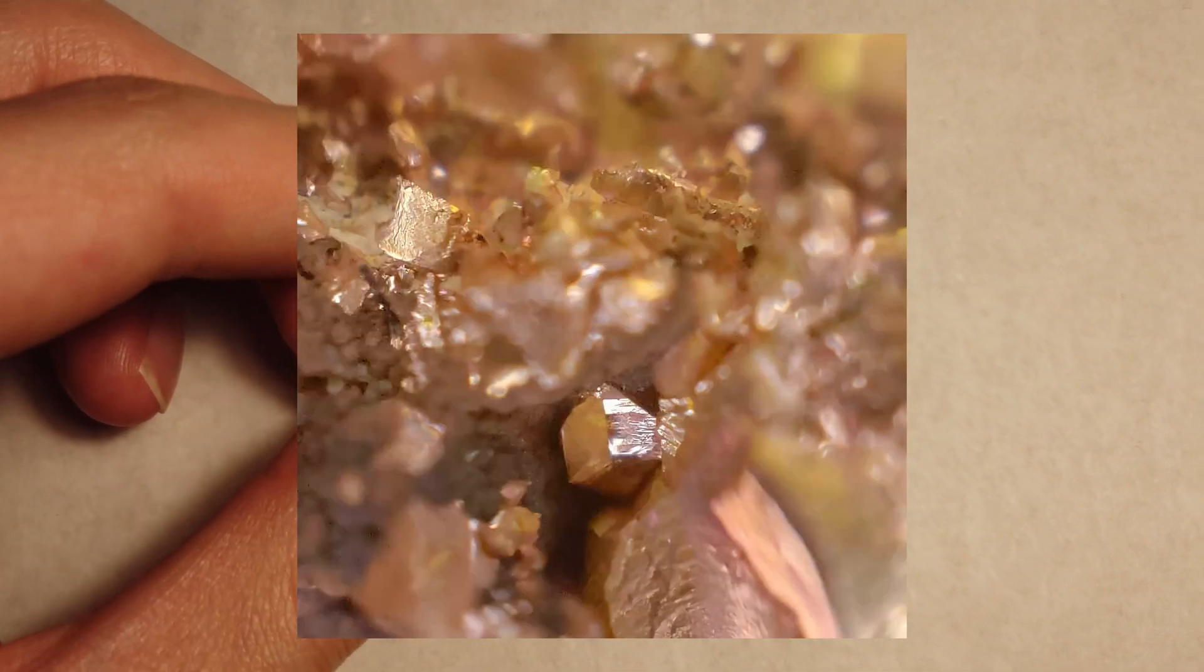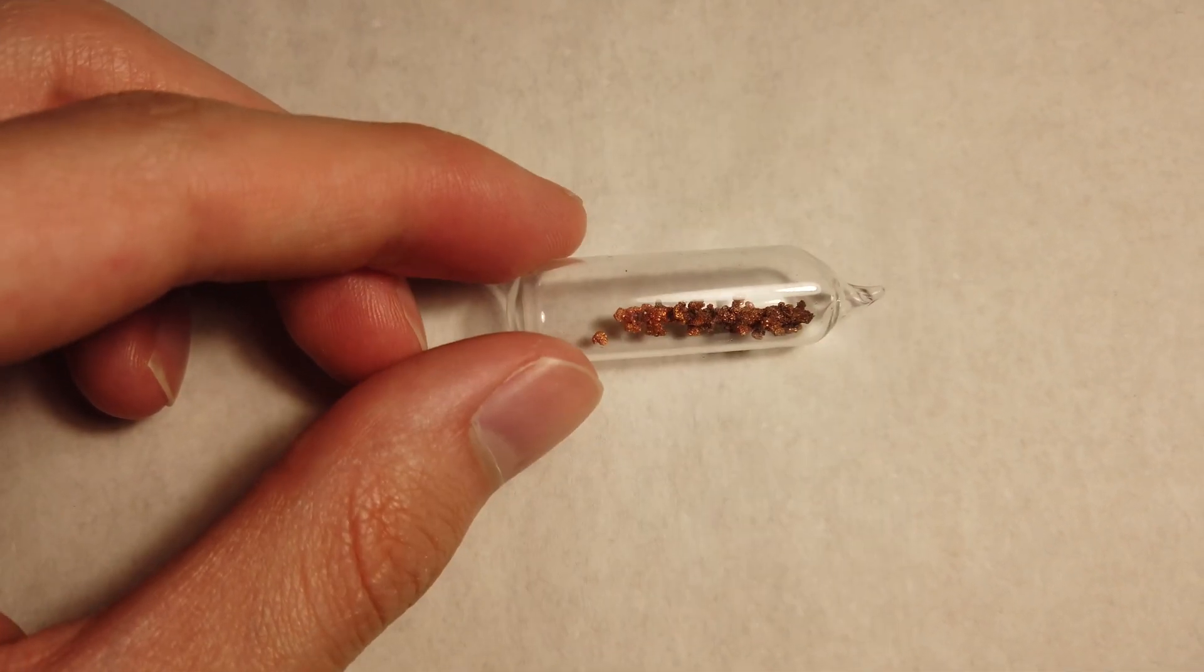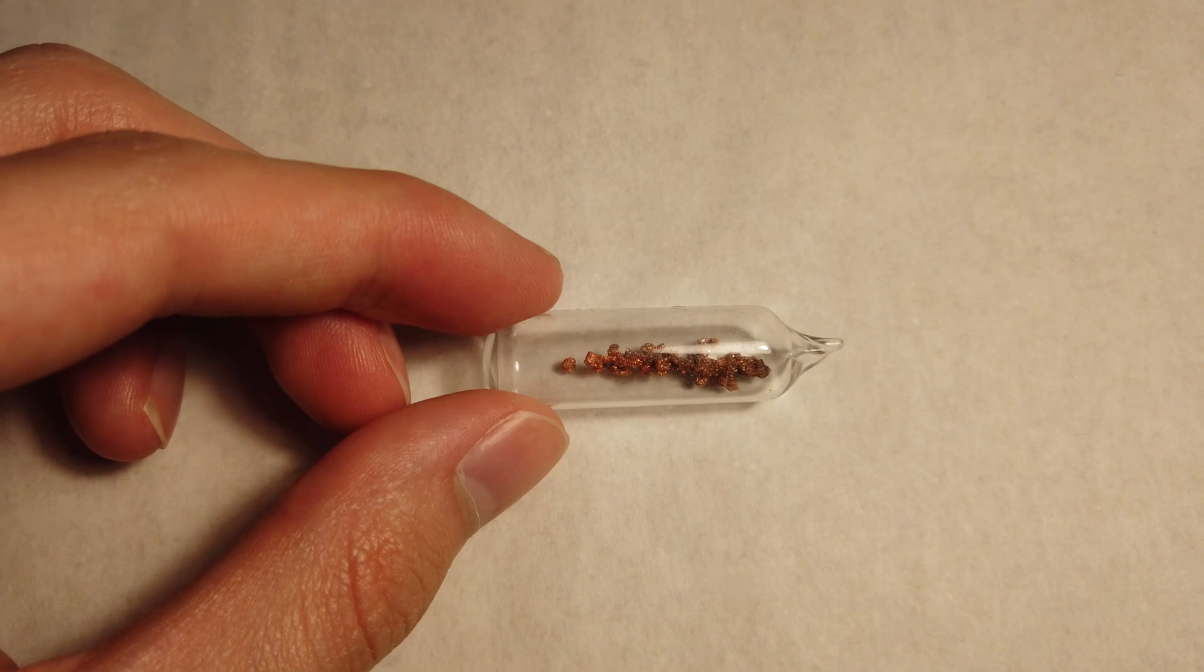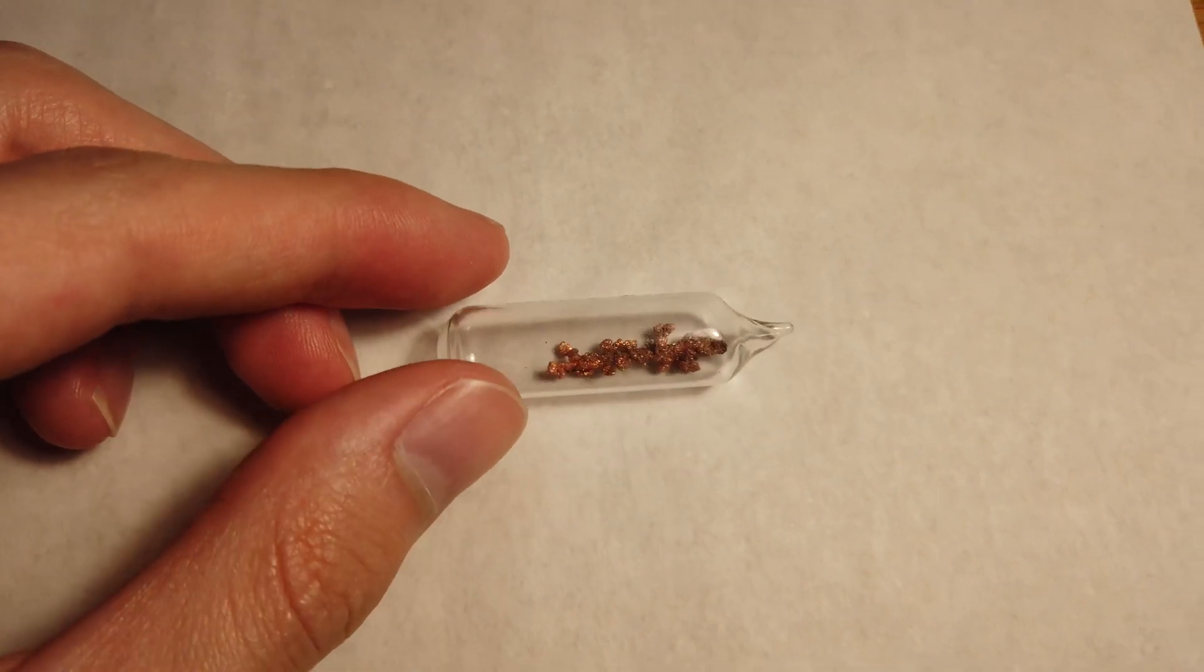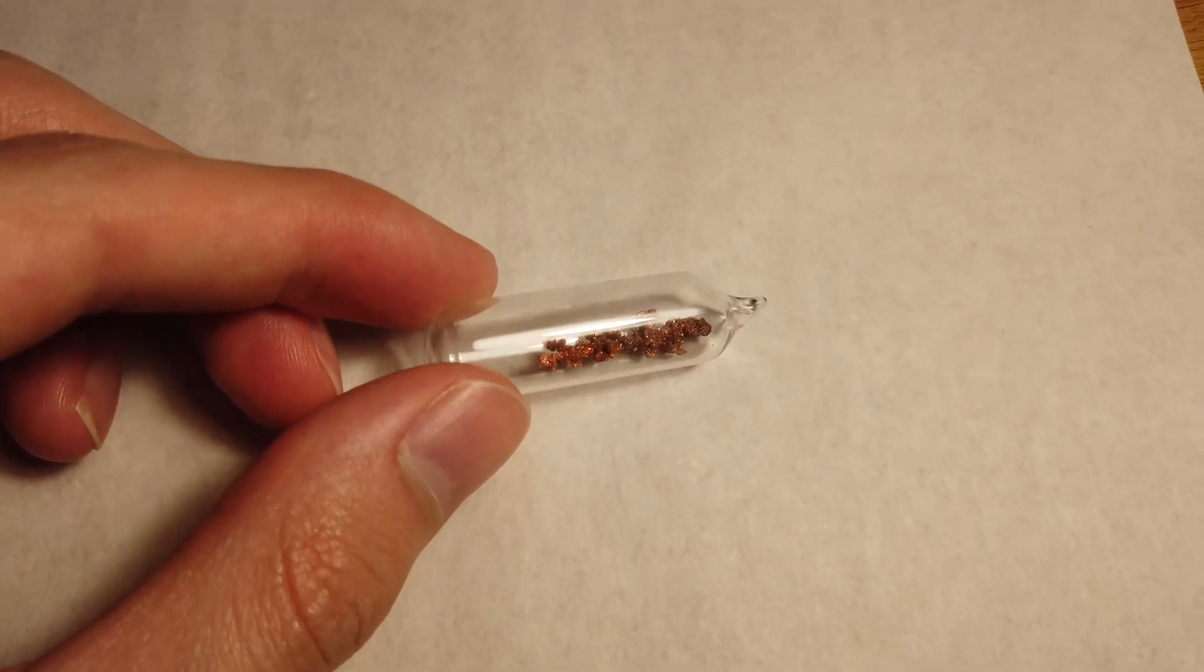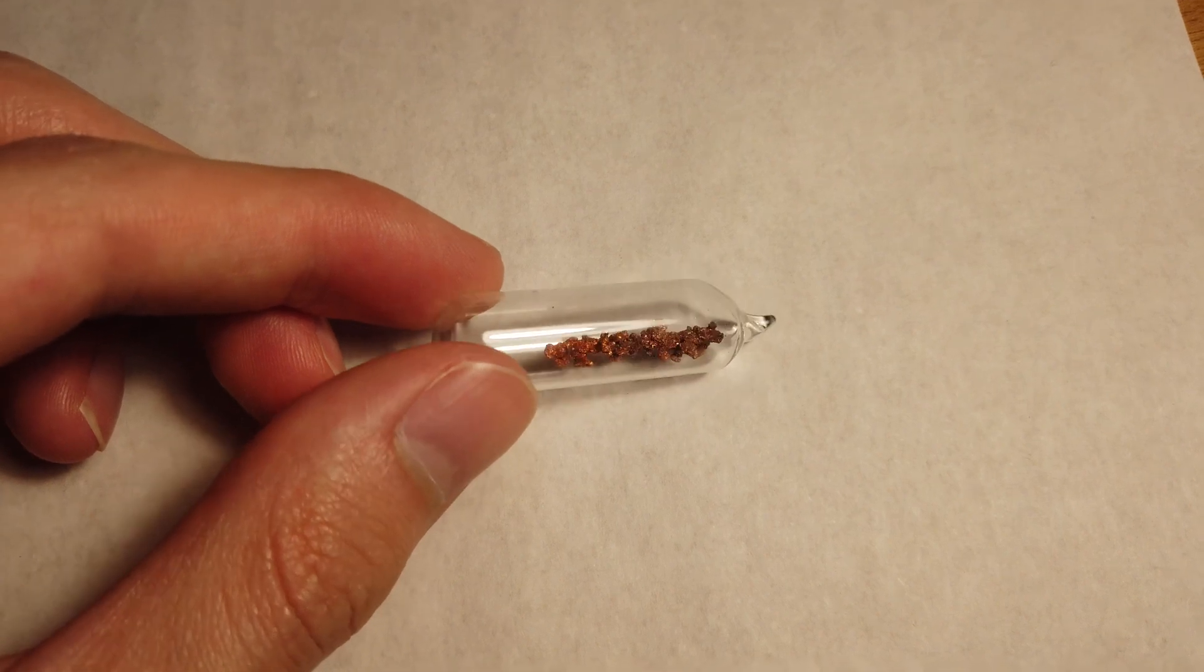But overall, not really the crystals that I was looking for when I started this project. I'm sure someone in the comments will tell me what I did wrong. It's not that bad, but maybe I should have acidified the copper sulfate solution, something like that.